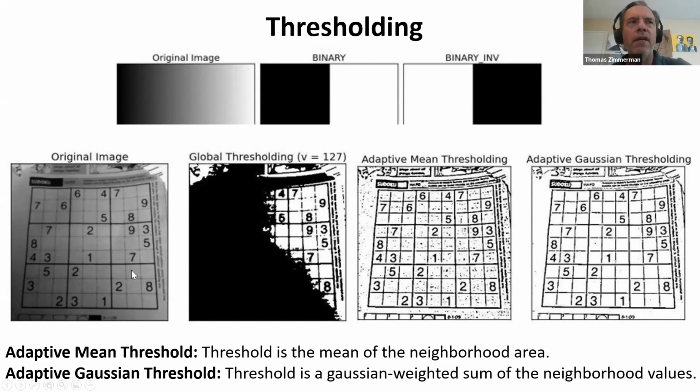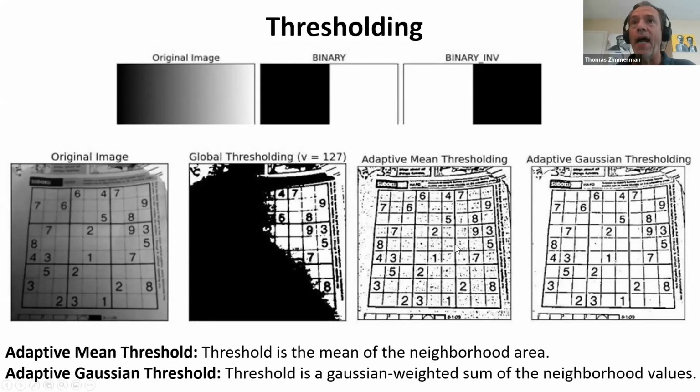As it moves over here, the whole background goes up. So now it sets a new average. So it's sort of like blurring, but it's a little more sophisticated. It looks in a larger area and determines what the local average is, and then compares the pixels to that local average. So you can think of it as kind of spatially adaptive. And you can see how much it improves. Even so, big variations in the background are filtered out by this mean threshold method.